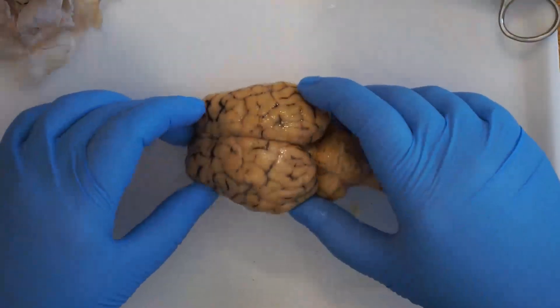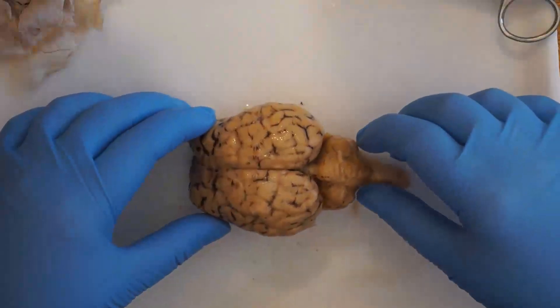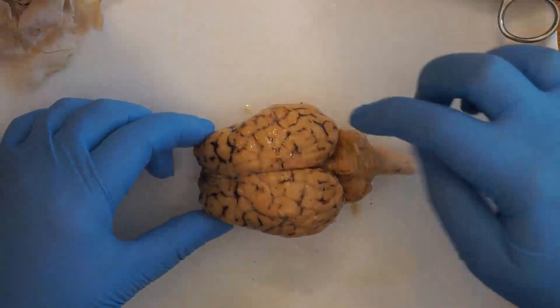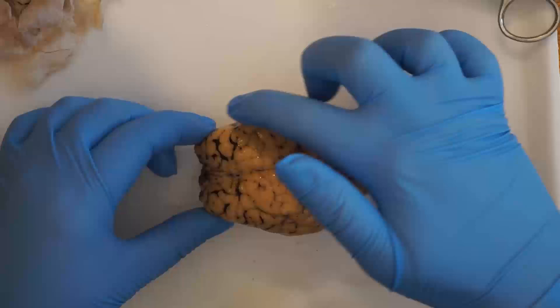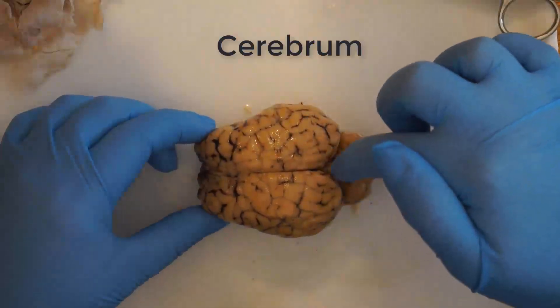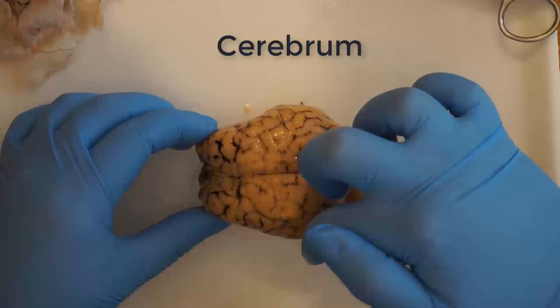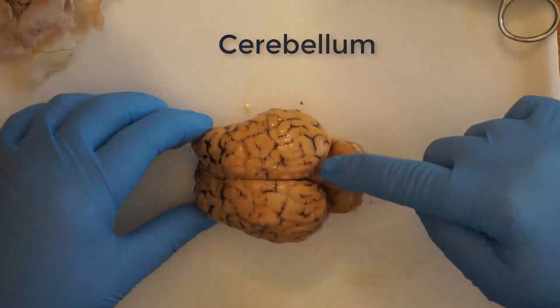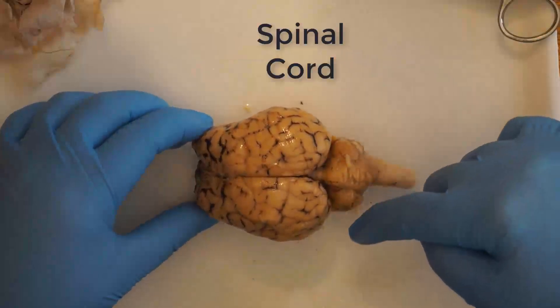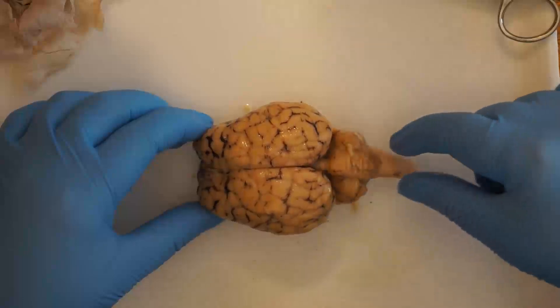Now that you've removed the dura mater, let's take a look at some of the external features. Starting with the cerebrum, which is the largest portion of the brain. The cerebellum is found behind that, and the spinal cord is sticking out of the cerebellum.